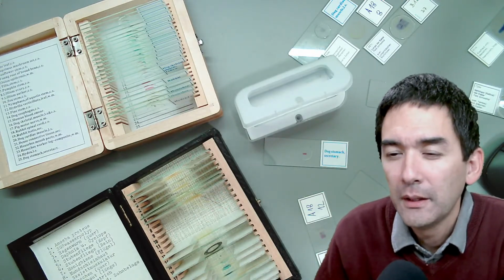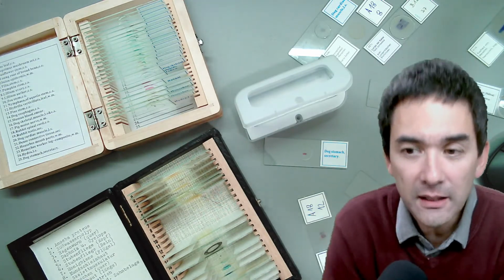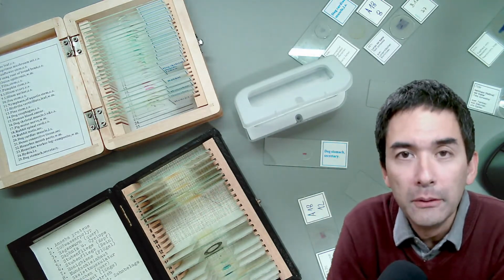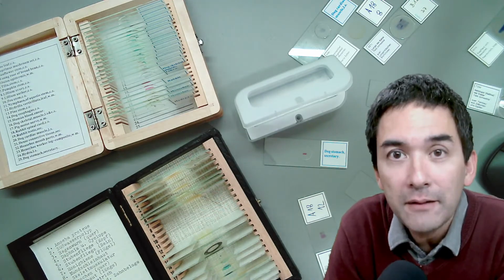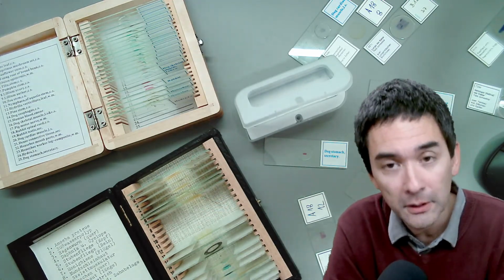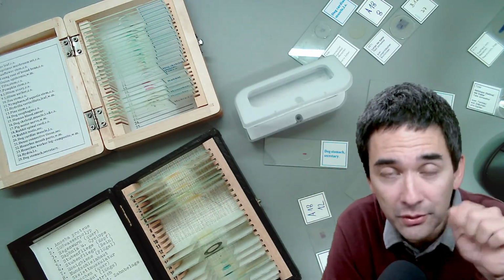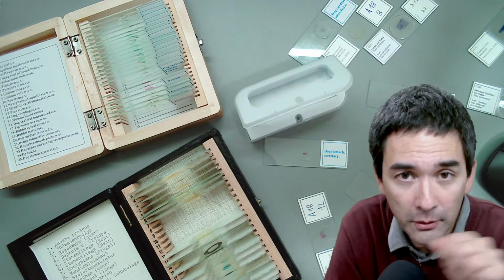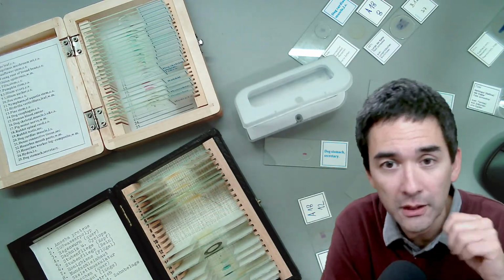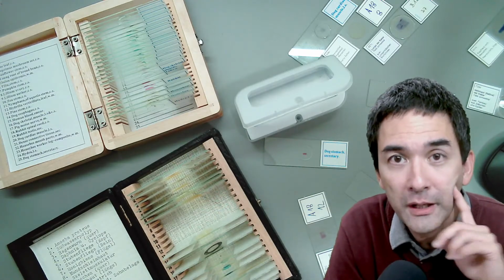What stain do I use to see white blood cells? I've used methylene blue, Löffler's solution, and I made videos of this. It's actually quite easy. You take a drop of blood, you add a little bit of this methylene blue solution to it, and you mix it. That's important. You take a toothpick and mix it, and then you put a cover glass on top, and that's it. It's pretty straightforward.